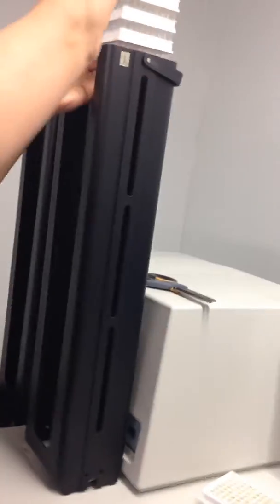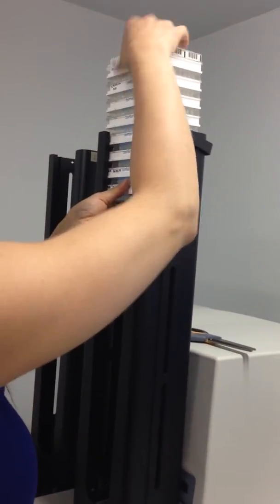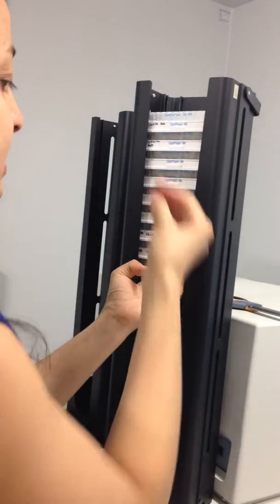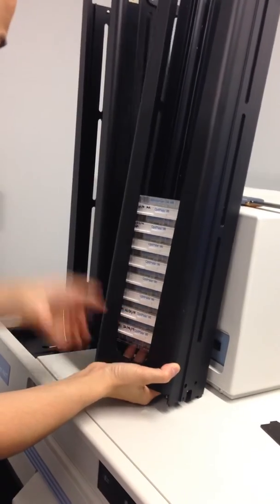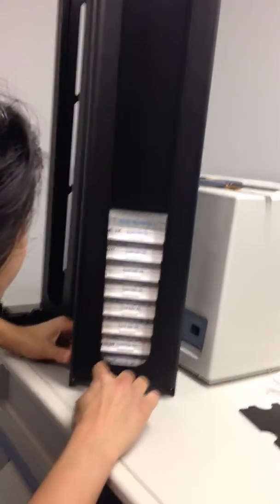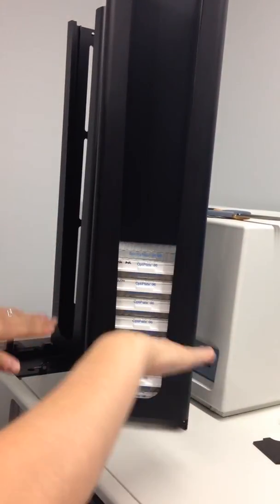So now we put this here. It's very important that they stay stacked nicely to each other. So as I do this, I press down at the same time and move them to make sure they're still stacked properly. There are springs at the bottom of the stacker on which they're going to land. Sometimes the springs are maladjusted, and it's important that you examine that the plates here are completely perpendicular to the line here, or completely parallel to the line here, and that should tell you that they are perfectly adjusted.